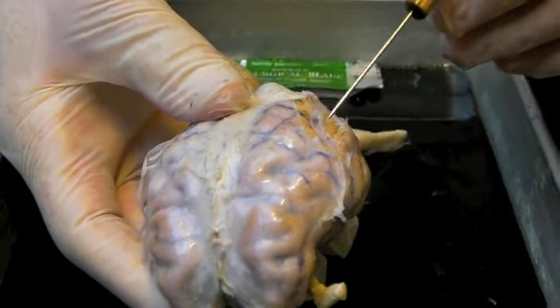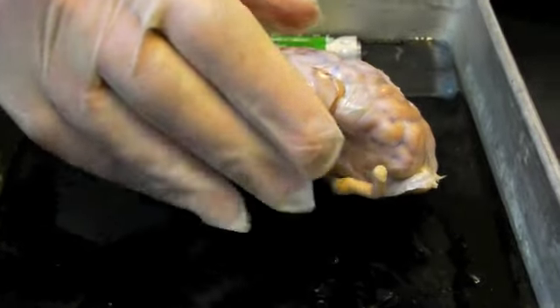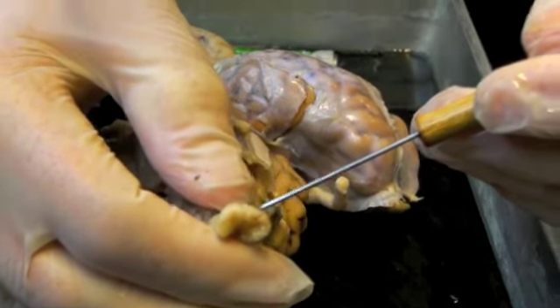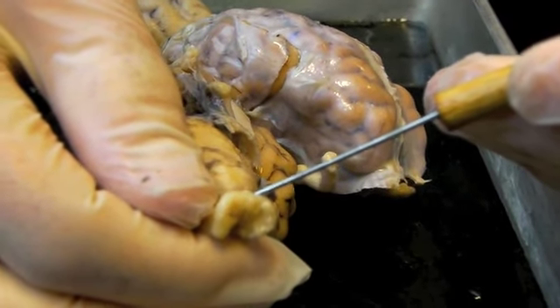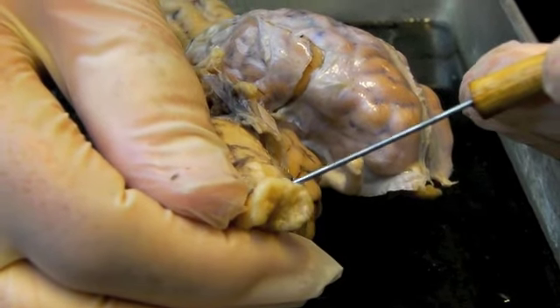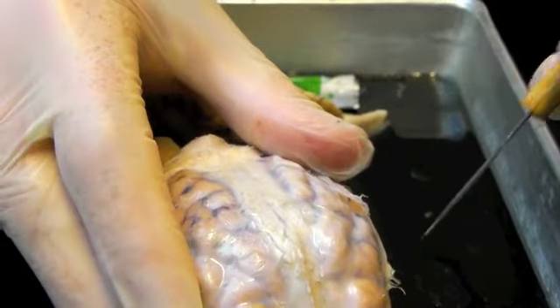And then there's a layer adherent to the brain, and I'm just going to show you a different specimen because this doesn't show it as well, called the pia mater, which is a whitish layer that's strictly adherent to the underlying central nervous system, brain, spinal cord. This is the pia mater. So the pia mater and the dura mater.